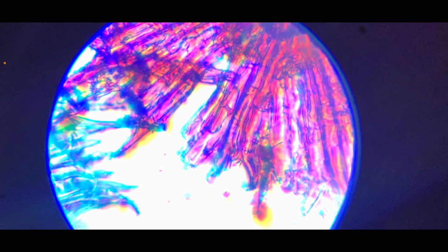But you can see that all these dark lines, they separate one plant cell from one another. So each one of these small things is a plant cell. We haven't even looked into what each plant cell looks like. If we did, the things are going to amaze you and make you drop your jaw.